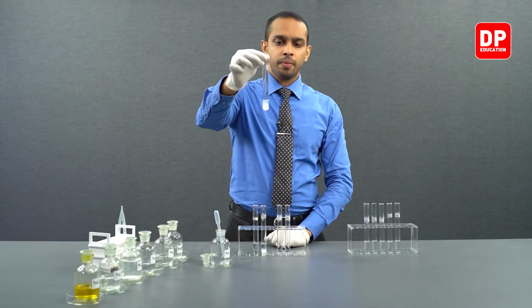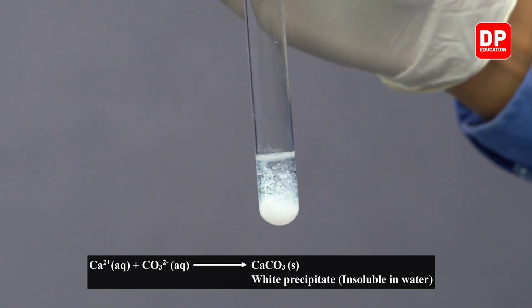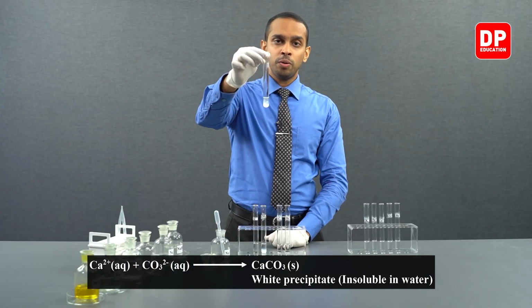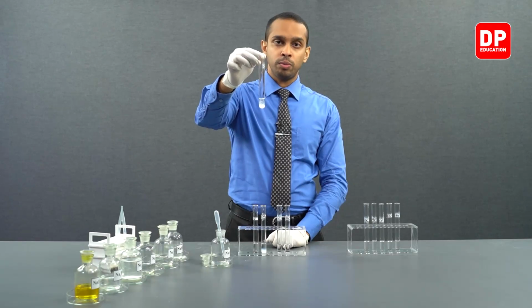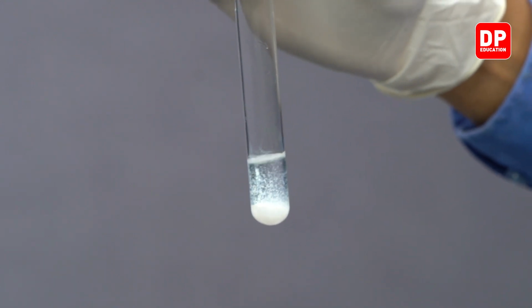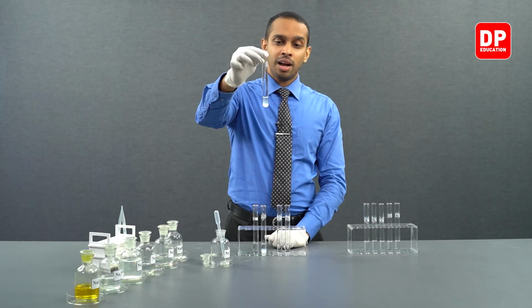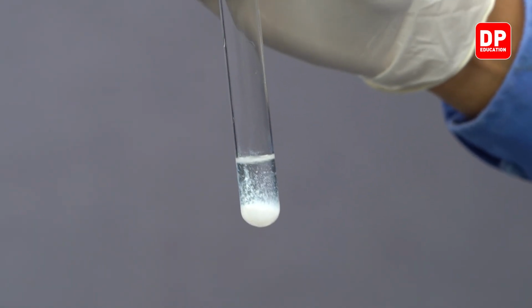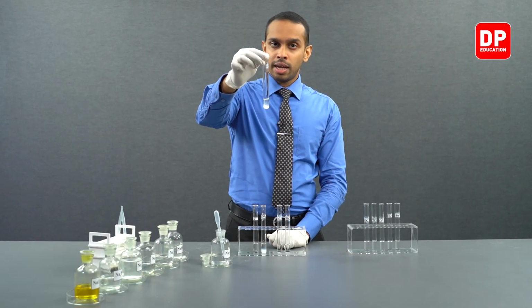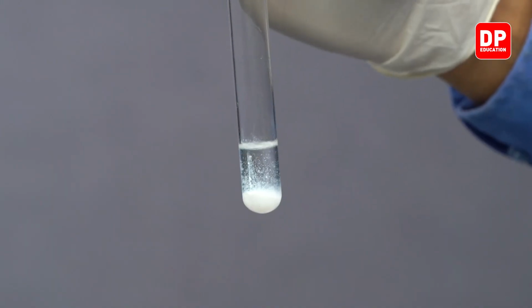You can see upon addition of sodium carbonate or carbonate ions into calcium 2 plus ion solution, a white precipitate was formed. Again, as I mentioned earlier, as you go down the group, group 2 carbonates become less and less soluble in water. So calcium 2 plus ions, when reacted with carbonate ions, form calcium carbonate, which is a white color precipitate.